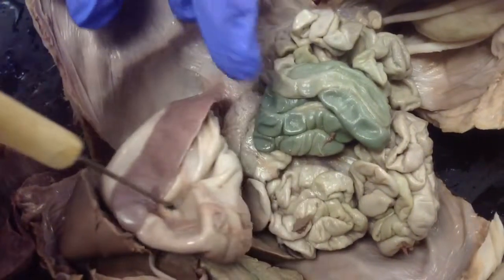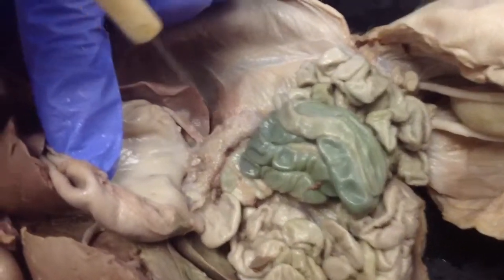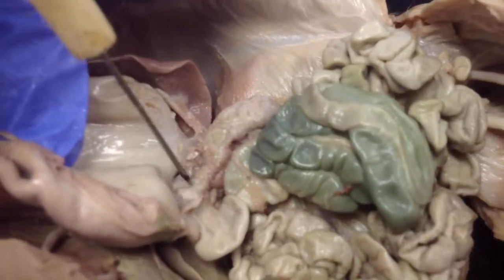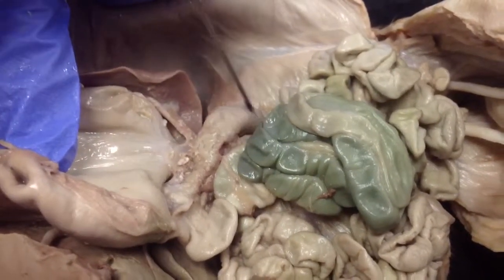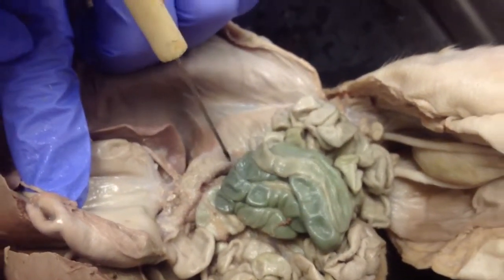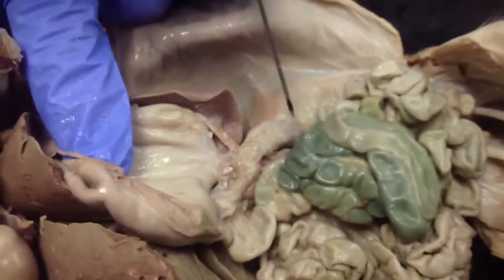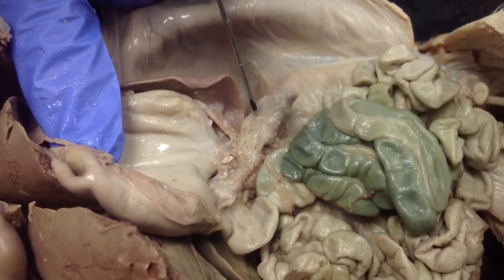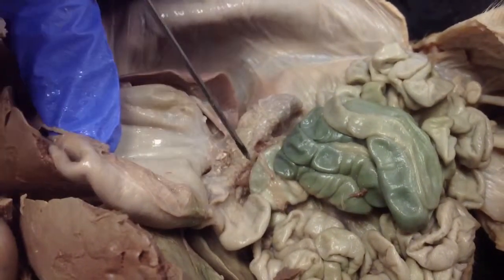Also, if you come over here, lift the stomach up, this little bumpy structure right here, that is the pancreas. Anytime you come across a bumpy structure, it's going to be dealing with the endocrine system, so hormones. This one has a job with both systems. It deals with releasing insulin, which helps control blood sugar levels, but it also aids in digestion and releasing enzymes that help break down the foods that are released right into the small intestines.